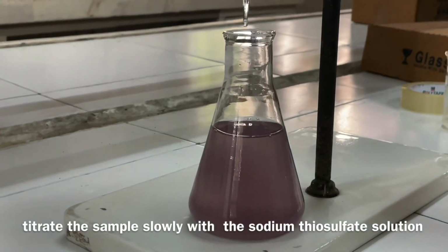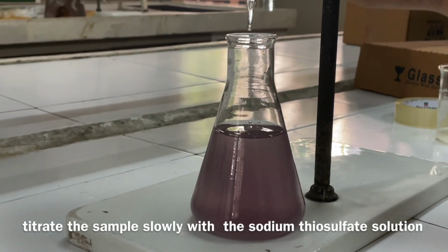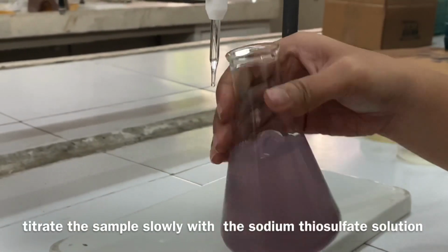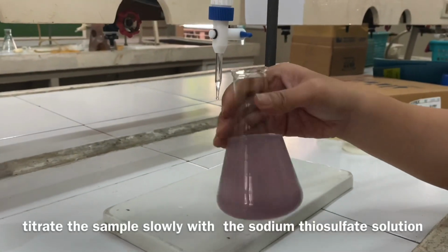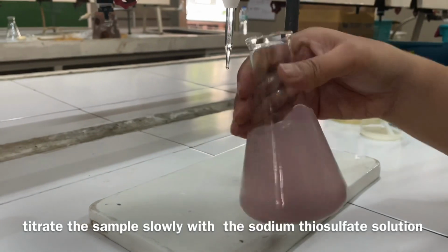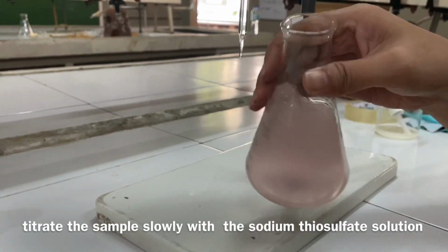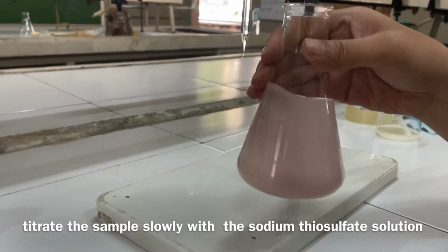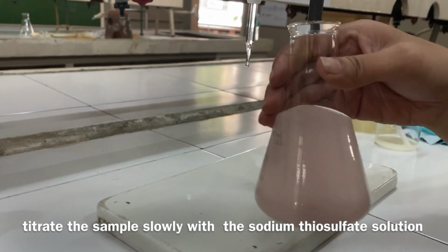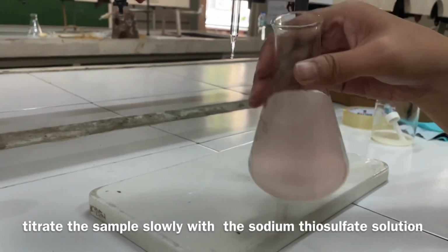Titrate the sample slowly with 0.025 normal sodium thiosulfate solution until the endpoint is reached. The endpoint is reached when the blue color of the sample disappears from the last drop of the titrant. During titration, be especially careful that each drop is fully mixed into the sample before adding the next drop. After adding each drop of the titrant, swirl the Erlenmeyer flask containing the sample.